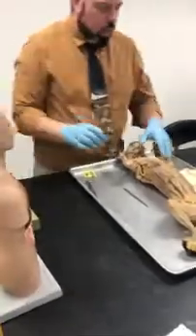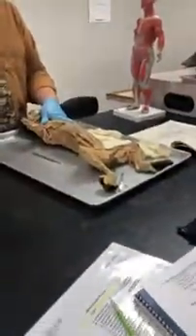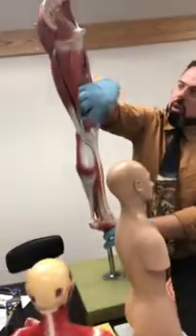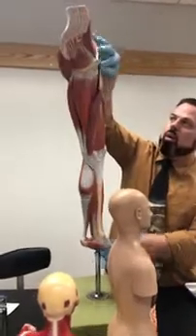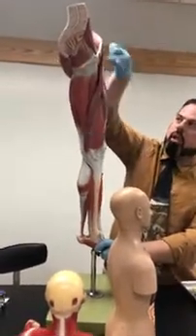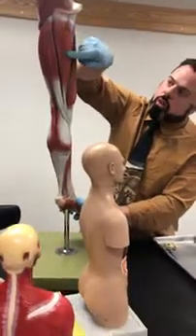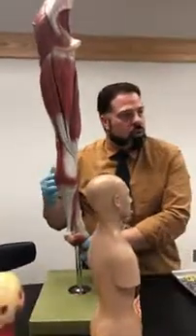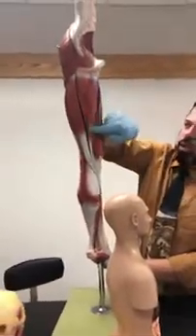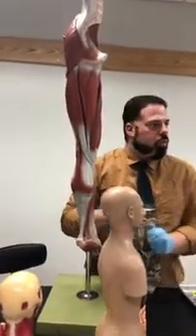All right. So first off, you got to pick the landmarks, and there's two good muscles in the thigh that are good landmarks. There's one over here, very long. It's the longest muscle in a human's body. What is this called? Sartorius is this one here, okay? You also have another good landmark, this one here in the middle of the inner thigh. And think of a ballerina dancing gracefully with her legs. This is the gracilis, okay? Those two are great muscles to identify, good landmarks.